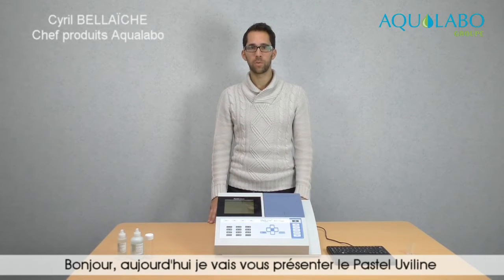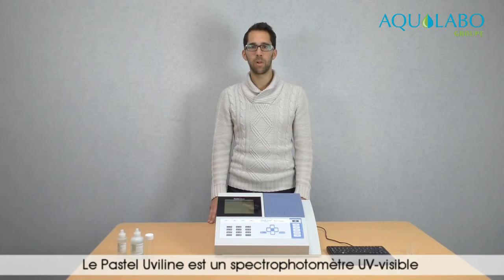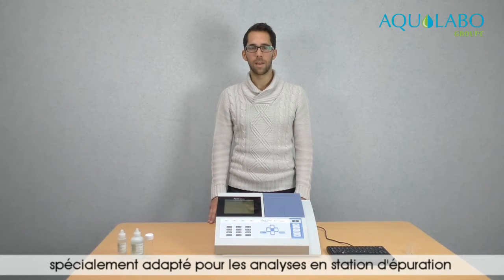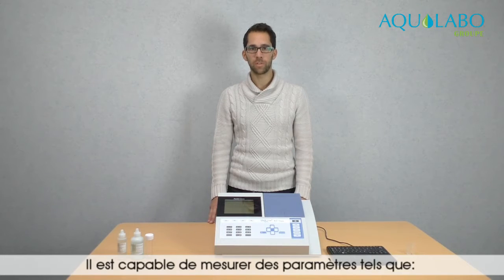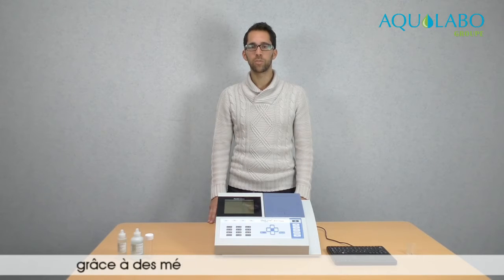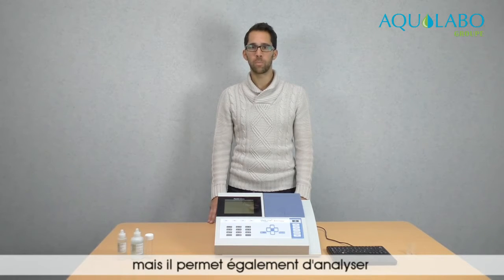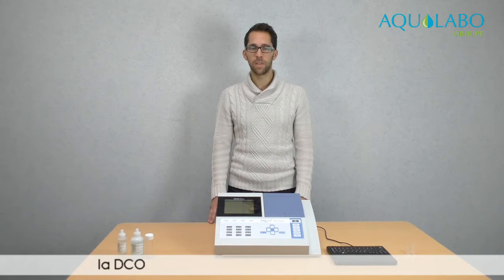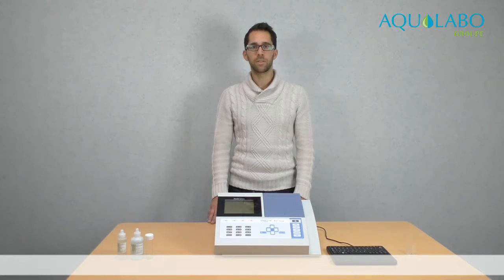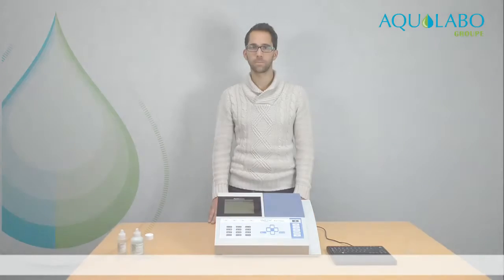I'm going to present you the Pastel Uviline. The Pastel Uviline is a UV visible spectrophotometer dedicated to wastewater analysis. It is able to measure parameters such as phosphates, nitrates, ammonia, thanks to methods using chemical reagents, and it is also able to measure parameters such as COD, BOD, TOC, detergents, or nitrates, thanks to a UV method that doesn't require chemicals.